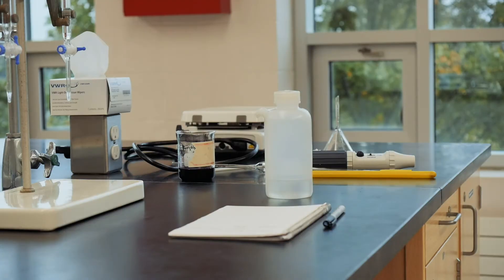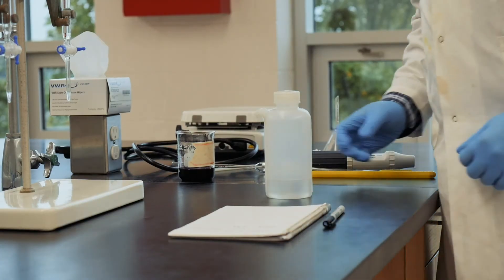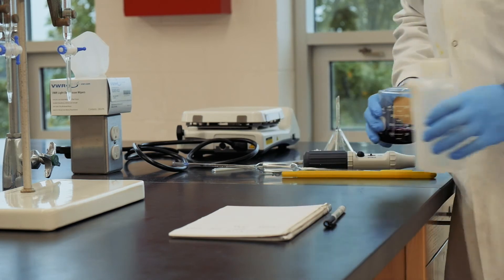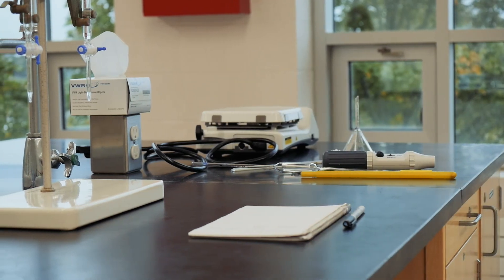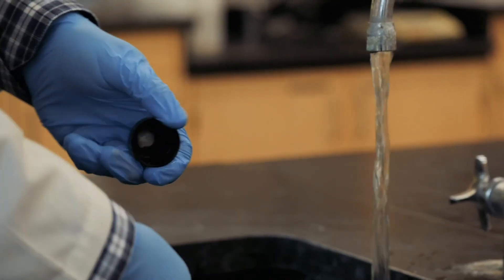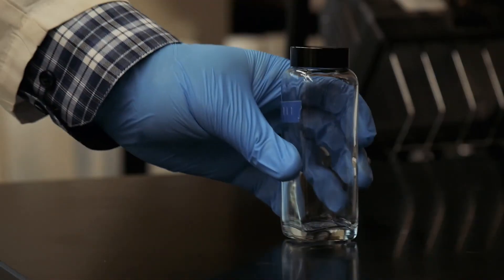You'll need to repeat the titration until two results are within 0.1 mils of each other. At the end of the day, make sure you clean your burettes, pipettes, and volumetric flasks according to the directions in the appendix of your lab manual. Also, don't forget to empty your unknown bottles, rinse them out, and put them back on the counter.